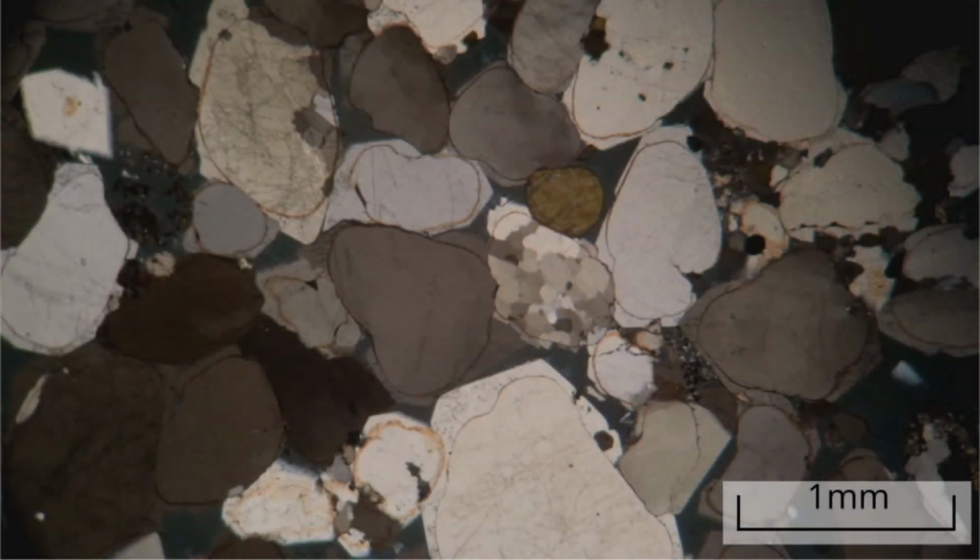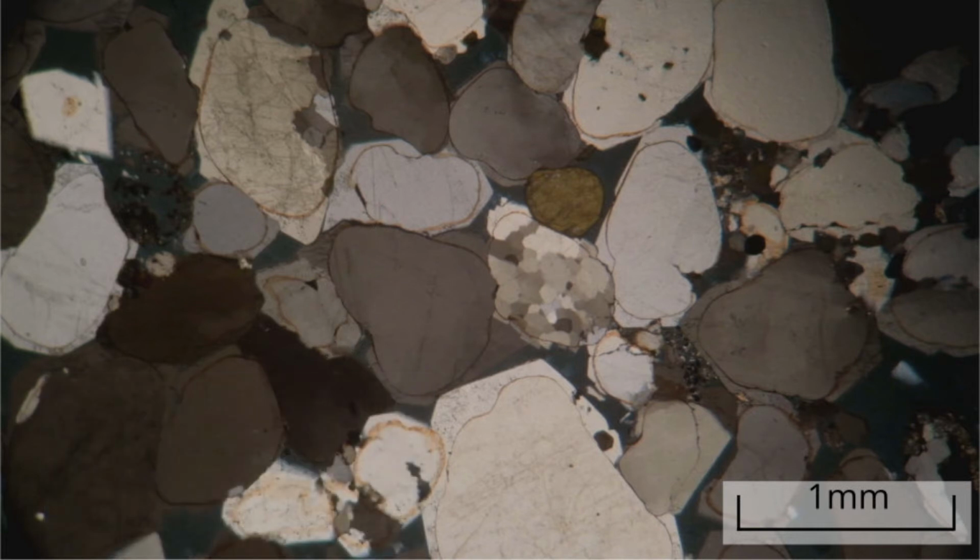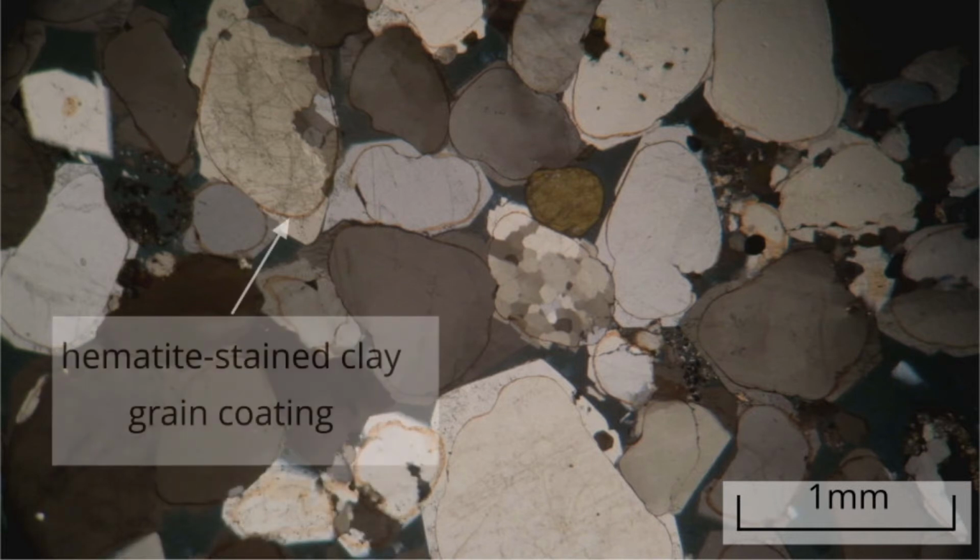Under cross polars, the quartz is identified by its first-order grey interference colours. It also shows no twinning. The hematite grain coatings on each grain are shown as a fine dark line on the edges of the original quartz grains.